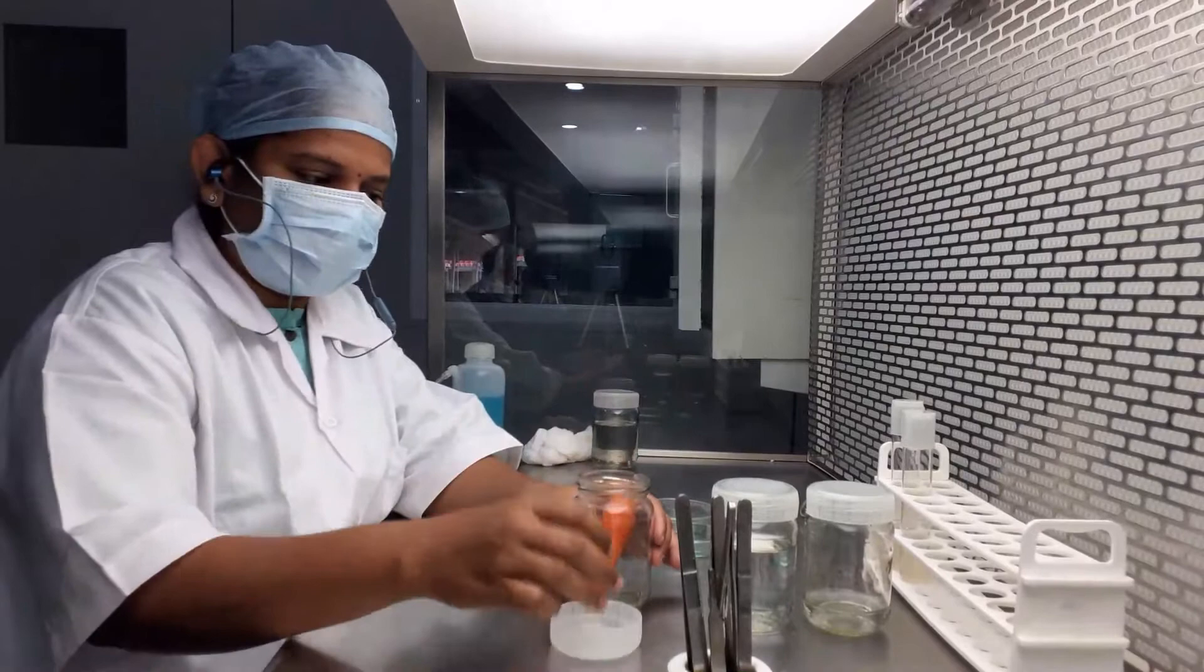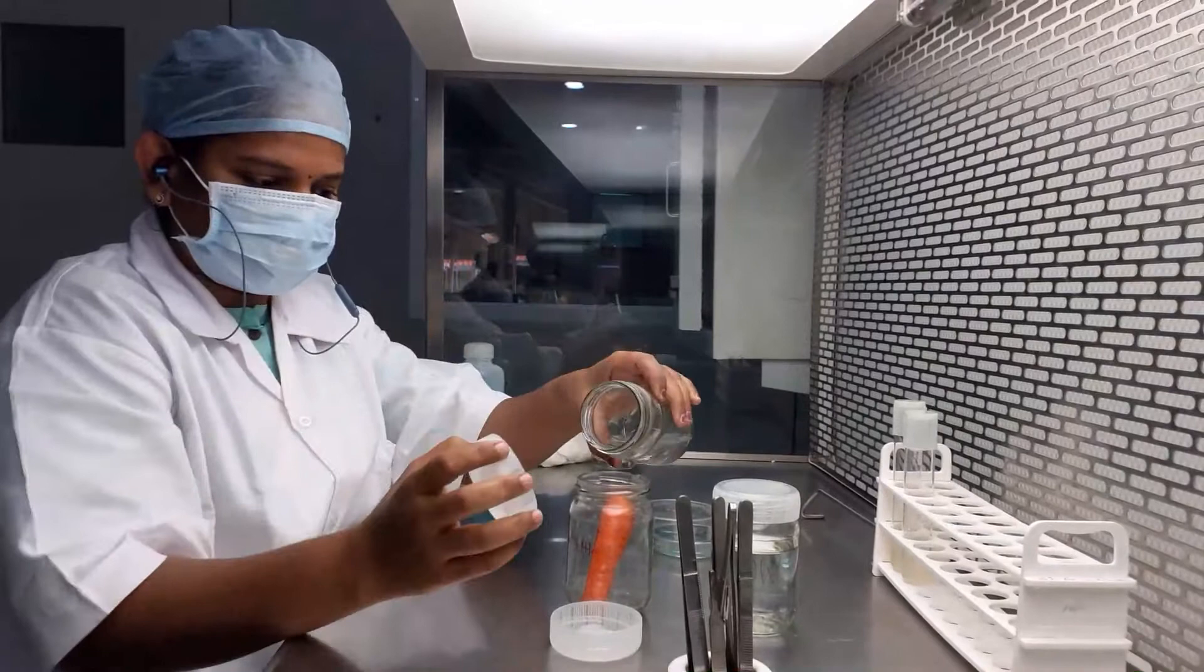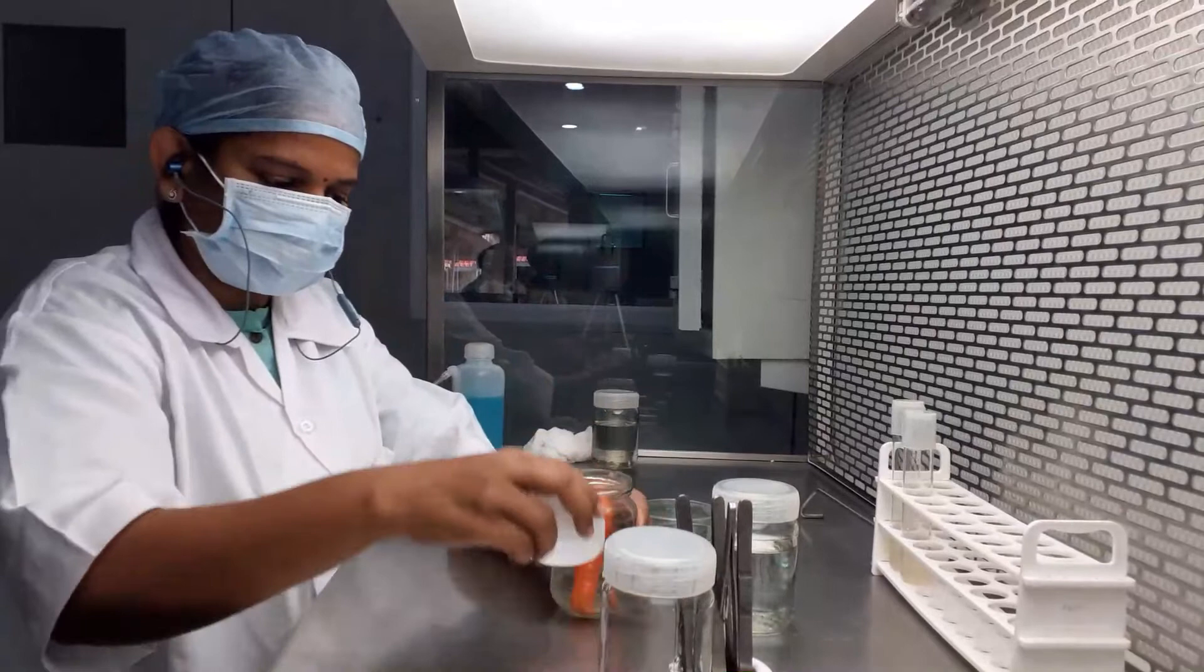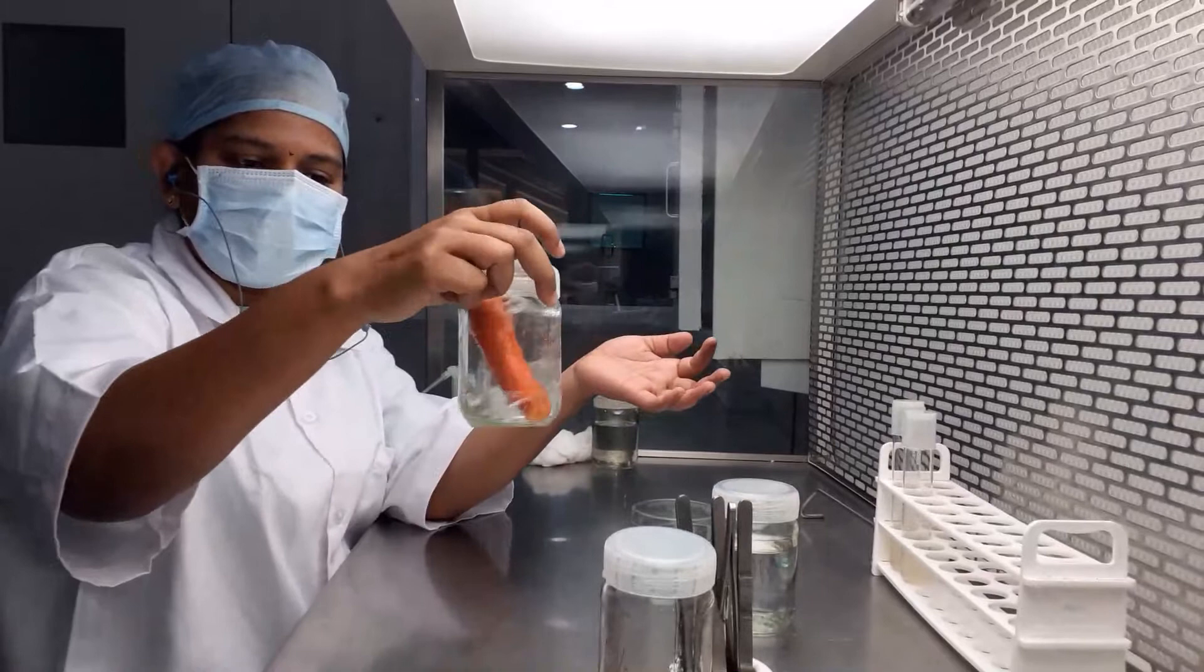We will be taking the HgCl2 solution at 0.1% concentration, and we will be giving the treatment of HgCl2 for about 10 minutes.